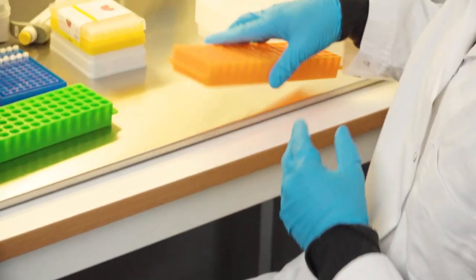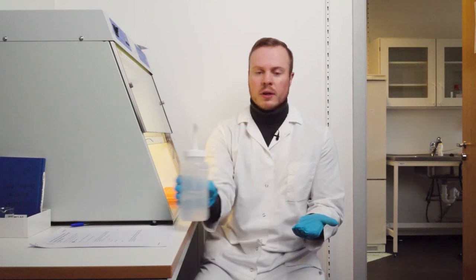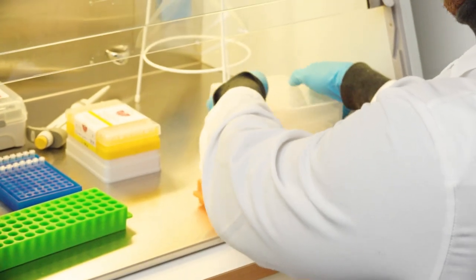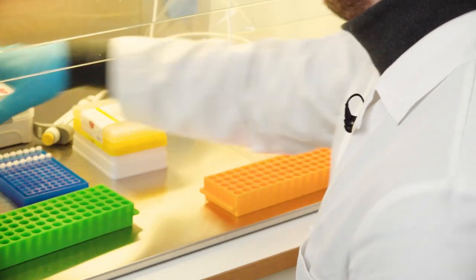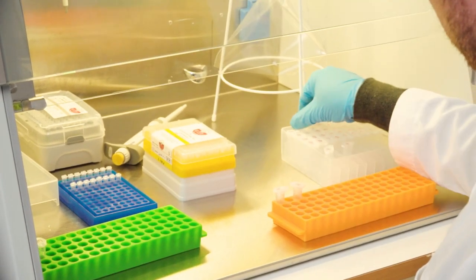And of course, since I have moved, it's again very important that I clean my hands or change gloves. Then I open the box with the samples and select the samples I want to pipet.